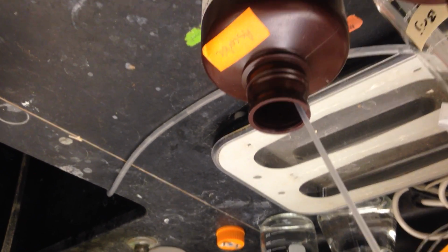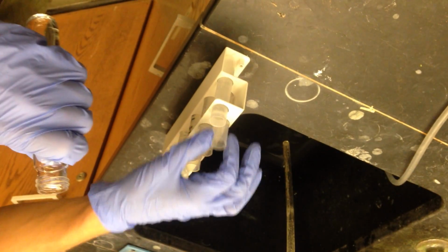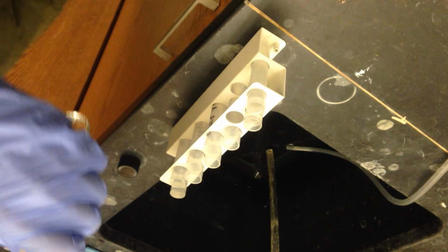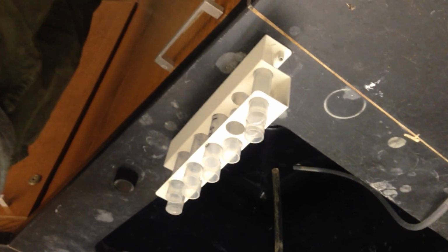Is it when you just use it, right? Yeah. So the highest concentrations are the first and the last. Mm-hmm. And then we move to over dilution. The last cup is one you have to keep an eye on throughout the run because it samples it multiple times, the drift cup. So you've got to go back and fill it after it goes through the calibration.